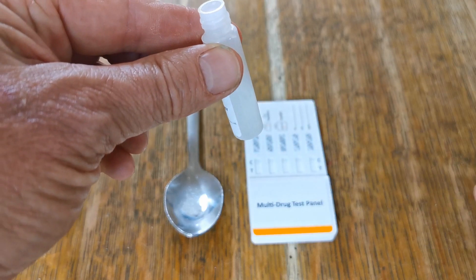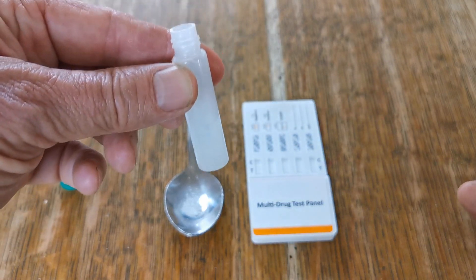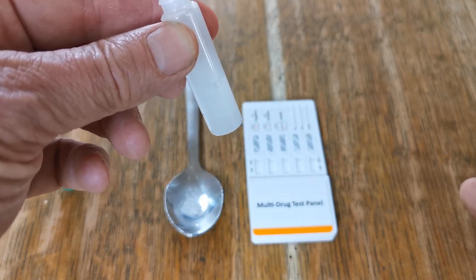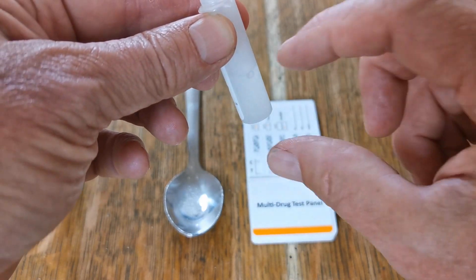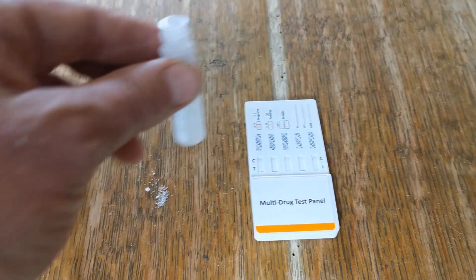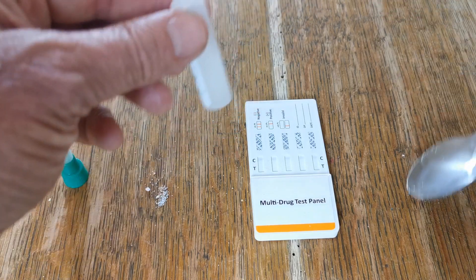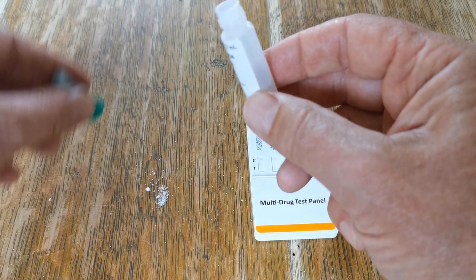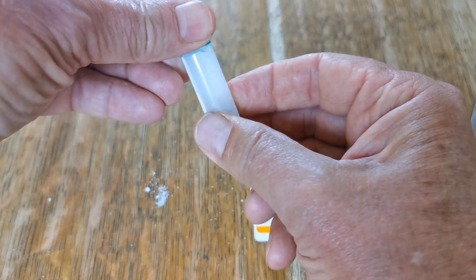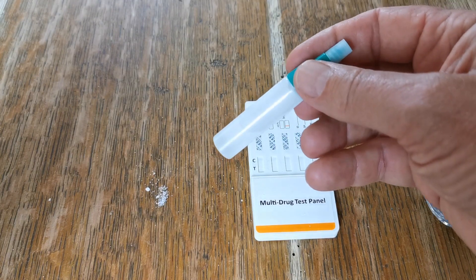The buffer usually takes around one and a half centimetres of the lower portion of the sample container. Do not add more than around 25% of the buffer volume in powder, residues, or vegetative matter. The reason for this is that some dry vegetative cannabis-like materials can be very absorbent when dry.